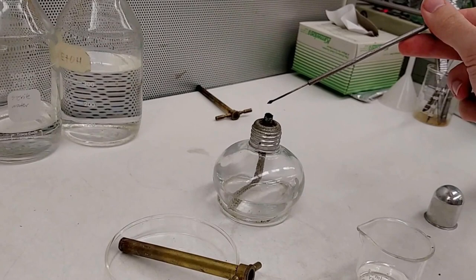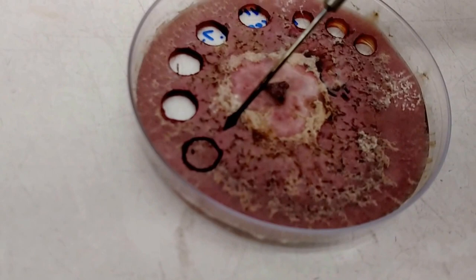First I'm going to sterilize it in ethanol. Like I said, to kill fungal spores or bacterial spores that I've been working with.